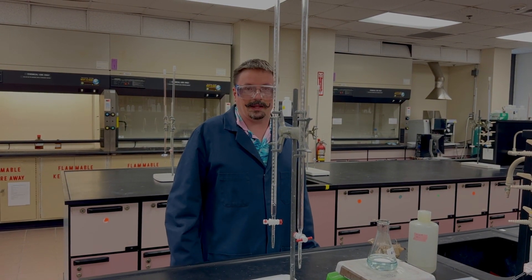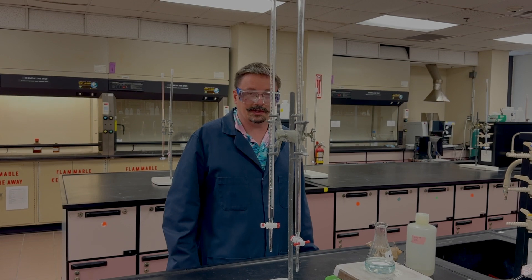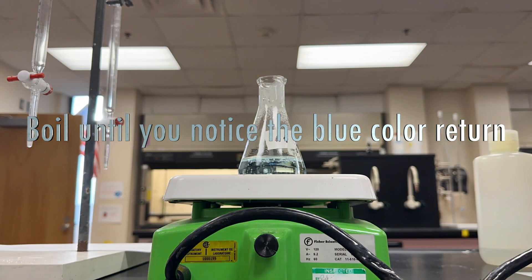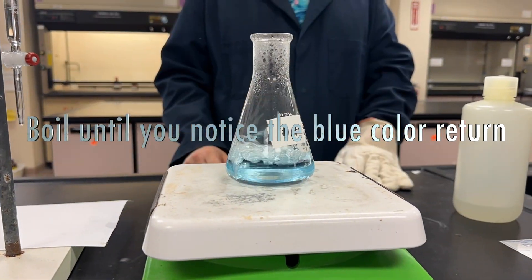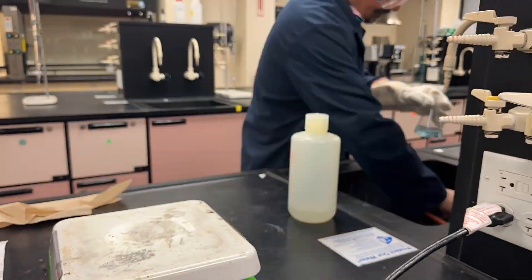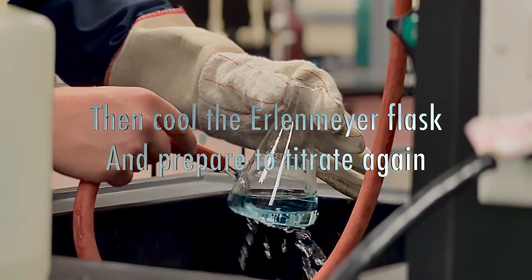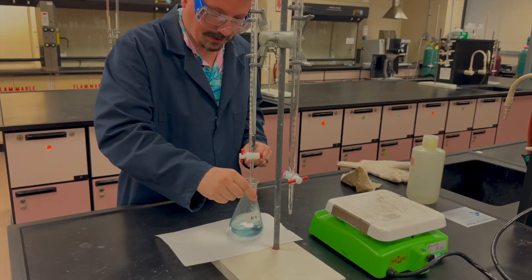Then we're going to finish that last step of that titration. After we boil it and get that color change, that very last titration is probably only going to take a few drops.